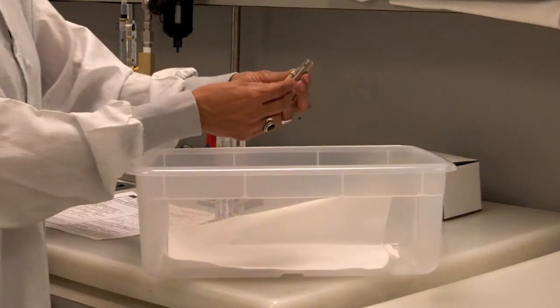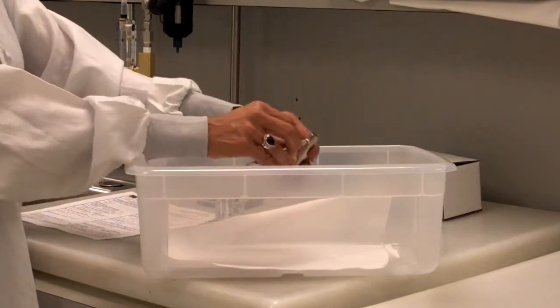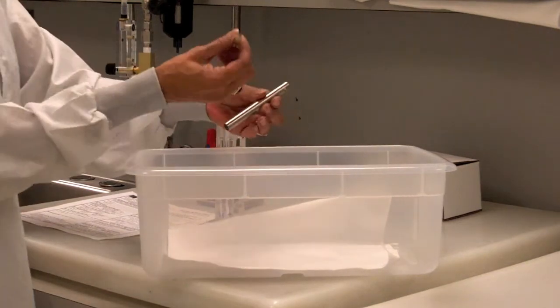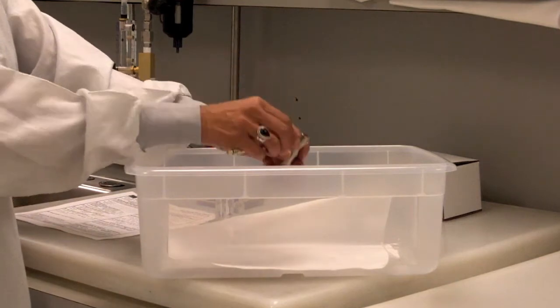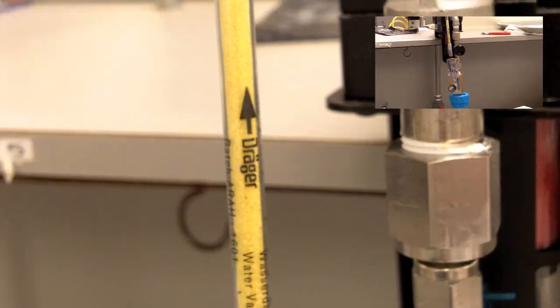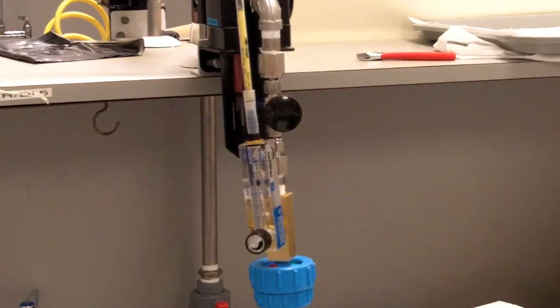Insert the tip of the tube into the smaller of the two holes of the tip breaker and apply sideways pressure until the tip breaks. Break both tips of the detector tube. Please use caution when breaking tips, inserting the tube into the tube flow meter, and handling the tube. Immediately insert the tube into the white tubing on top of the flow meter with the arrow pointing away from the flow meter. Rotate the tube until it reaches the fitting inside the white tubing.